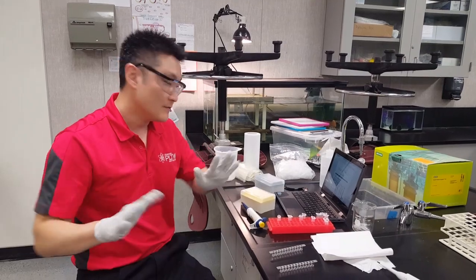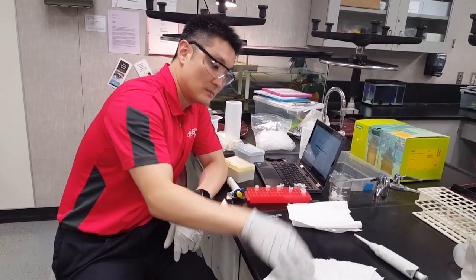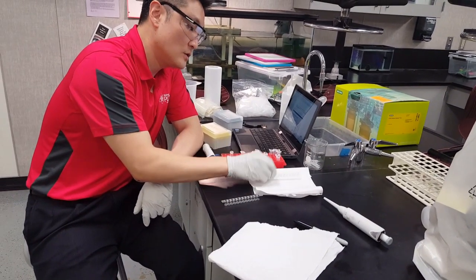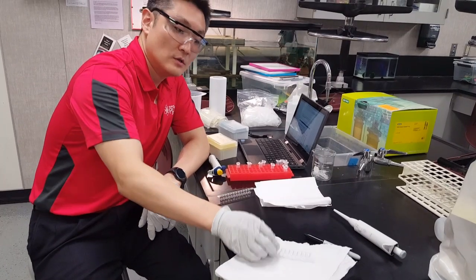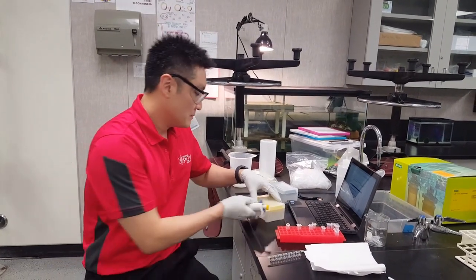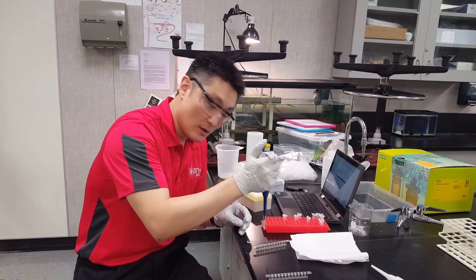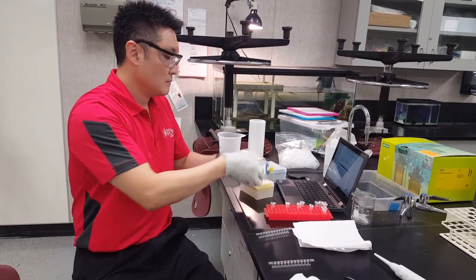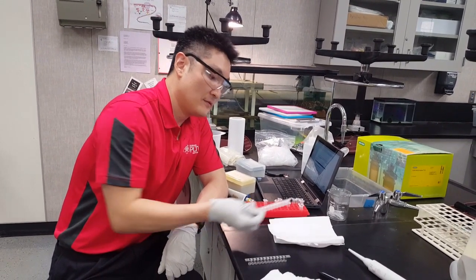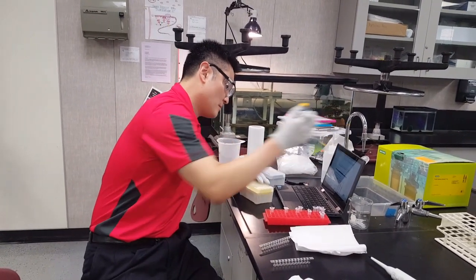After 5 minutes, get a new set of paper towels and invert 5 times to remove the primary antibody — 1, 2, 3, 4, 5 for both strips. Then add 100 microliters of wash buffer to every single well. Invert 5 times again: 1, 2, 3, 4, 5 for both strips. Change tips.